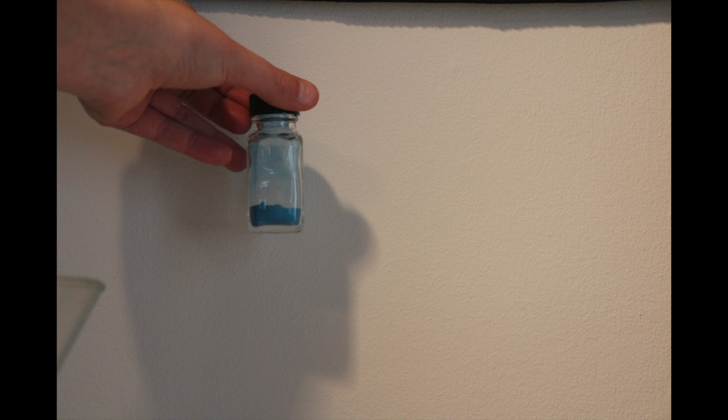Welcome to the Chemikid. In this video, we will synthesize copper aspirinate, an interesting copper ligand.